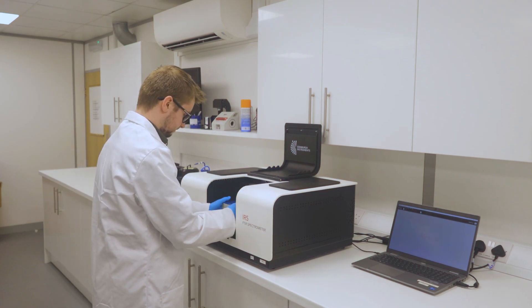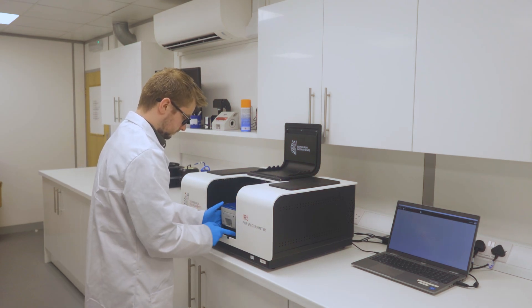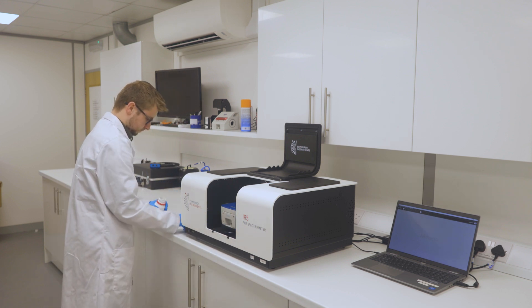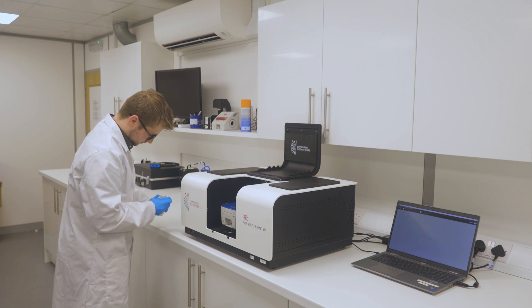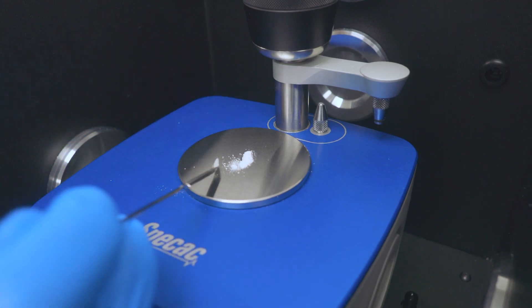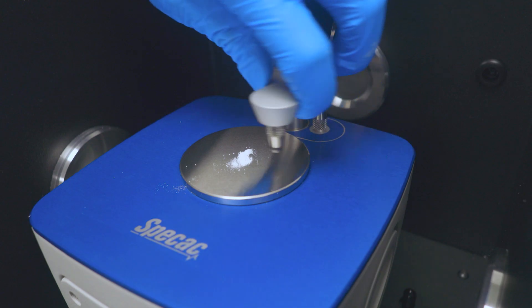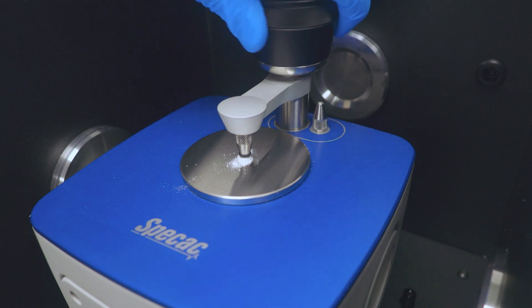For this demonstration we will be analysing an unknown sample. In order to analyse this sample we will be using the ATR attachment for the IR5. ATR is a fantastic sampling method and is becoming the gold standard measurement technique in FTIR. It is non-destructive and requires no sample preparation, making it quick and easy.